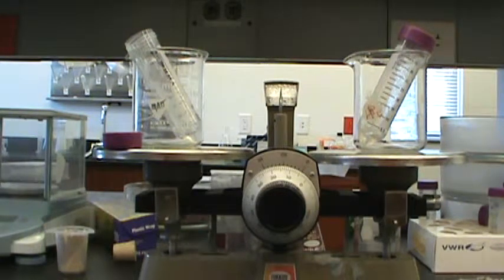Once these are balanced, then you can take them and put them in the centrifuge and spin them without worrying about it being unbalanced.